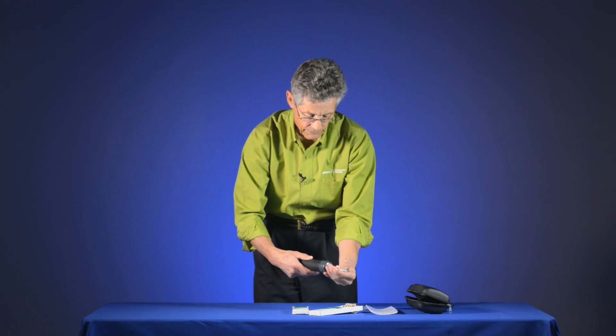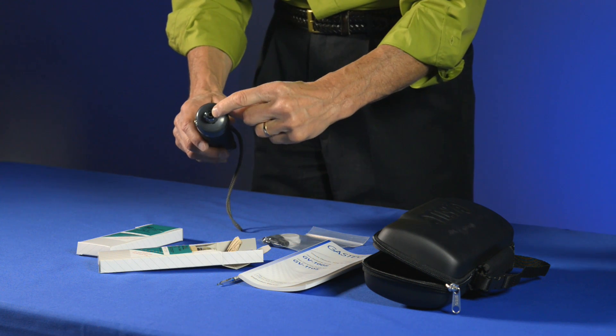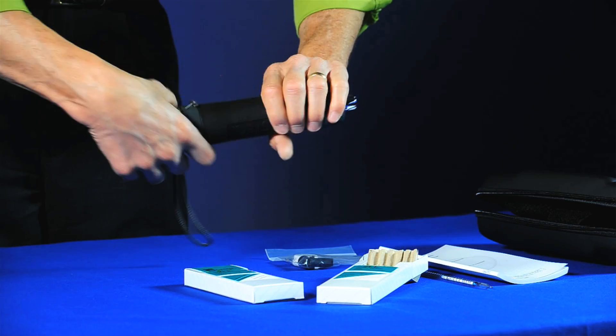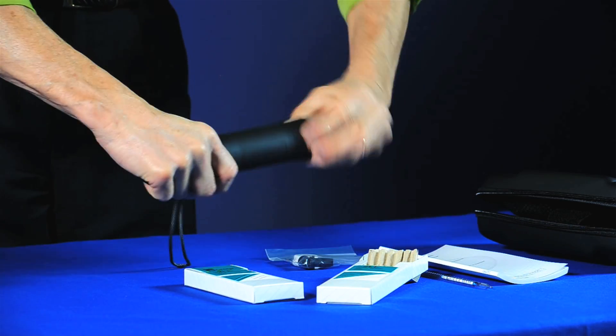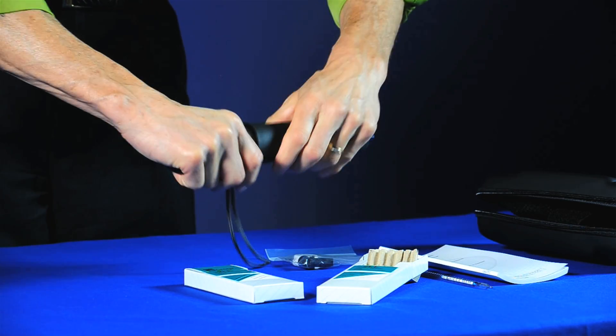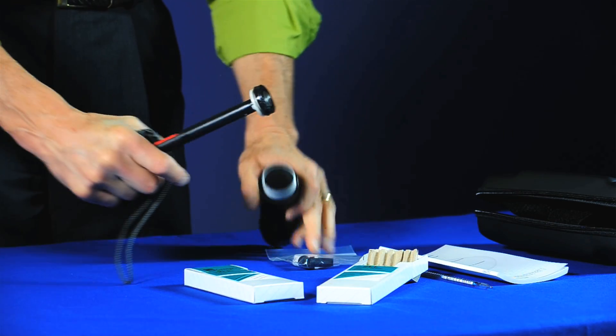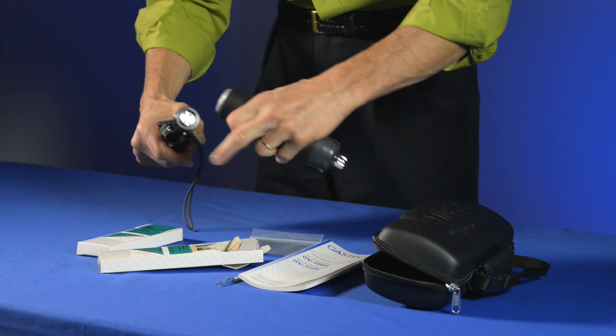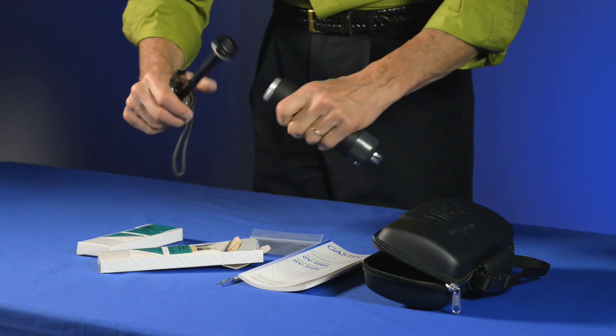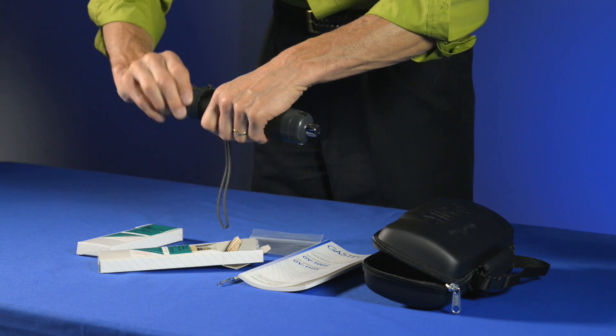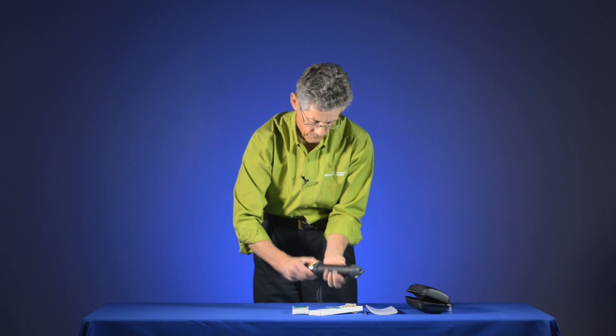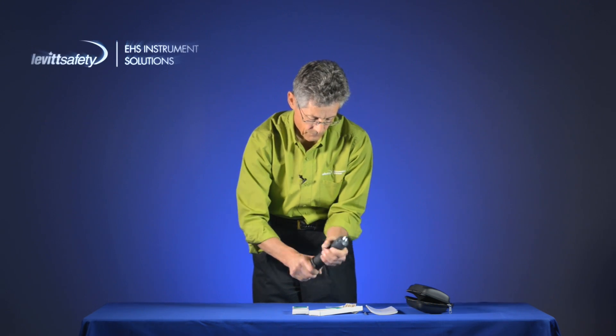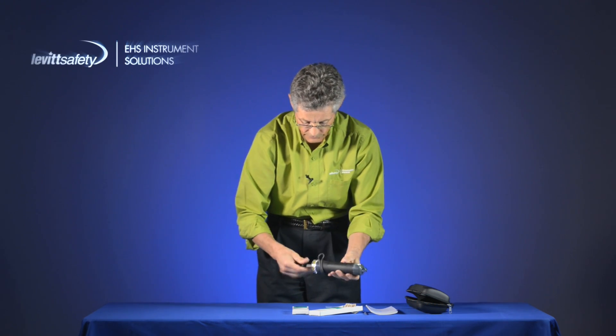If it did leak, you would have to perhaps replace the flange at the end or perhaps spin open the pump like this. And then use the grease that's in this little container and just re-lubricate the end of the pump and cylinder itself. And then you'd want to do another leak check.